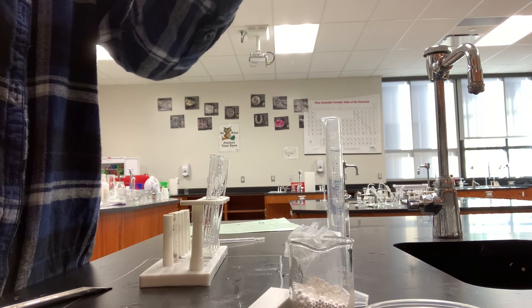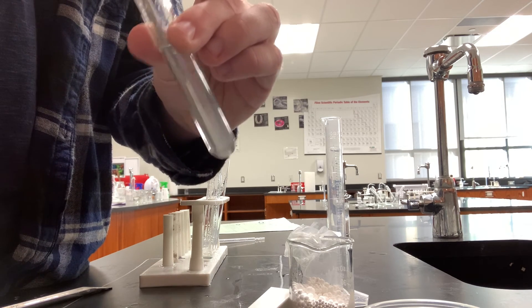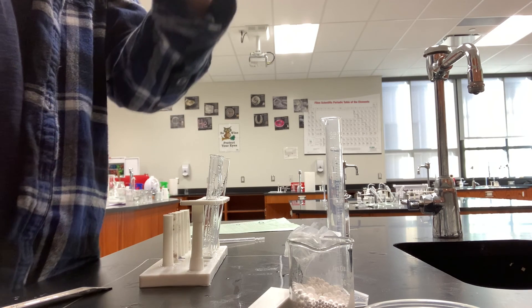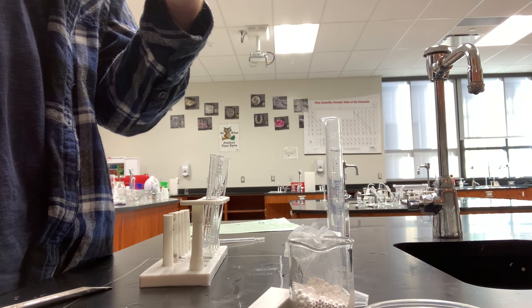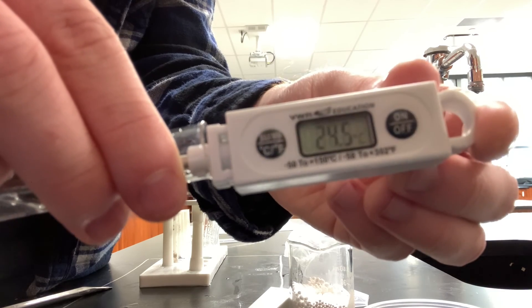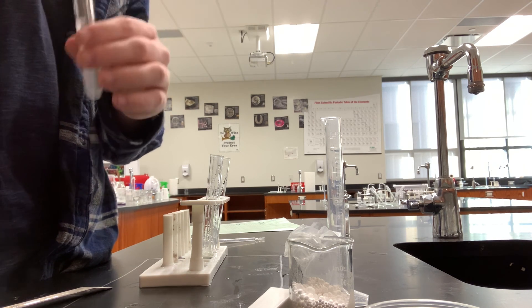It's starting to dissolve. It'll probably take a little while. So right now it's about 24 degrees Celsius in the test tube. We could wait for it to dissolve a little more, but we've already seen the temperature change, so that's it.